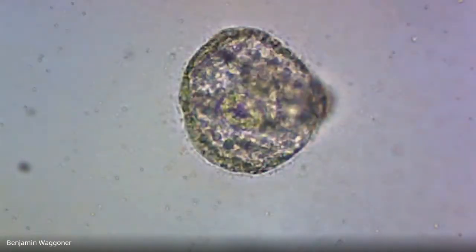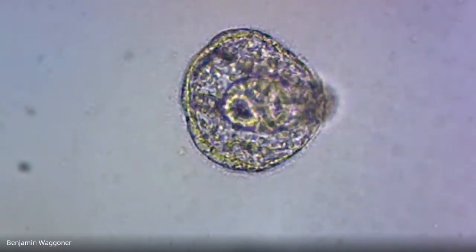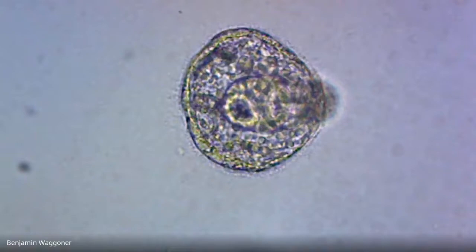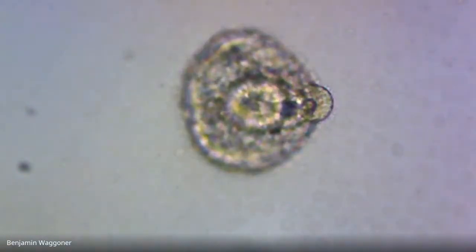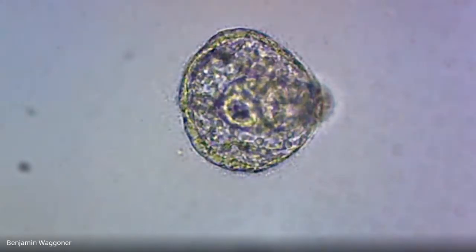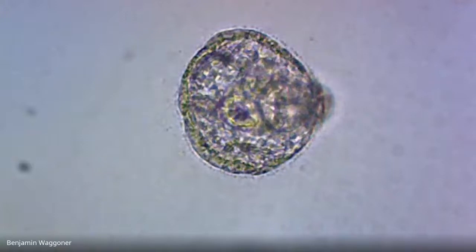Okay, when we do this write up, we're going to leave out the ones that are messes because we can't tell what the factor is that's causing that. So there we've got a prism larva. And again, I guess that schnoz right there maybe is part of normal development. You can see several portions of the gut as we focus up and down.